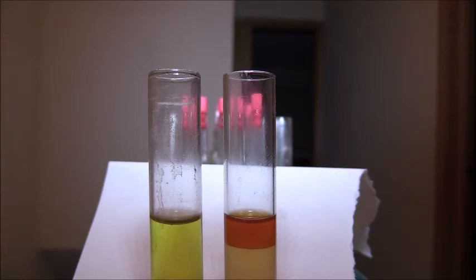The test tube on the left is my sample that I collected from the hydrothermal reactor. It is very hard to see in this video but there is a very thin layer of liquid which has a different color than the rest of the liquid in the sample.